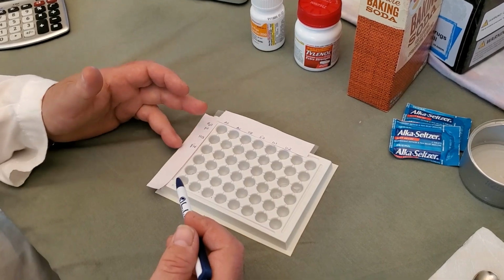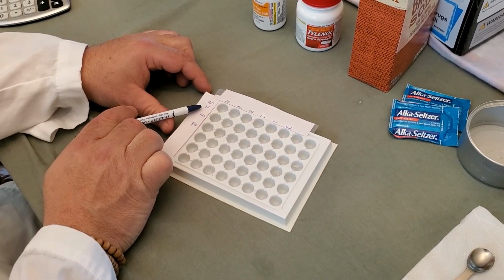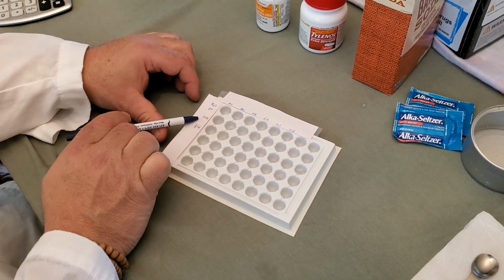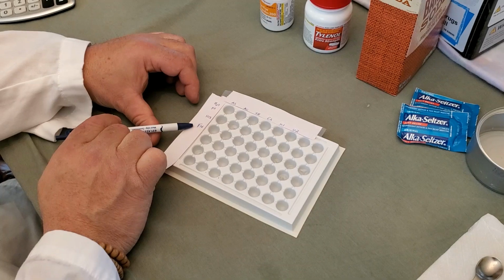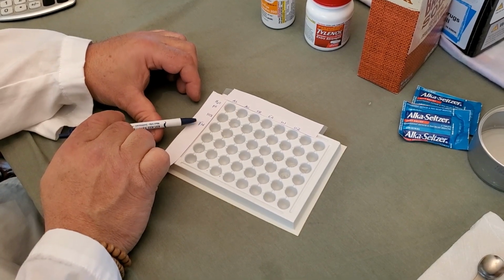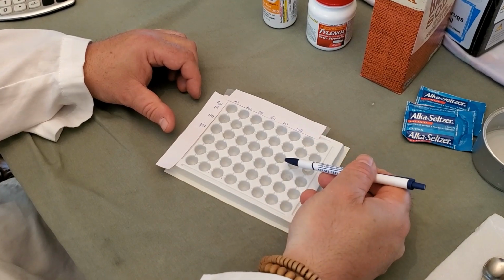These are going to be the tests we're going to perform. First, we're going to put water. Then we're going to test its pH. Again, I'll explain that in a second. We're then going to see if there's any reaction with hydrochloric acid. And finally, we're going to see if there's any reaction with the ferric nitrate. Based on the results that we have, we can hopefully figure out what our unknown is.